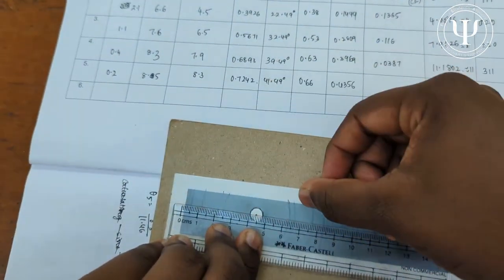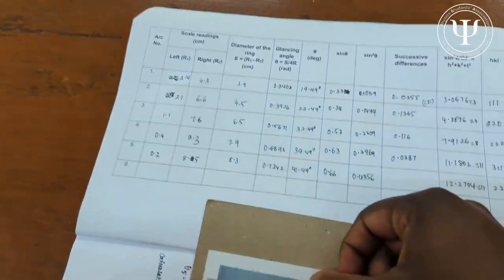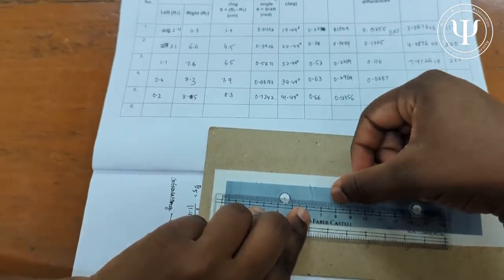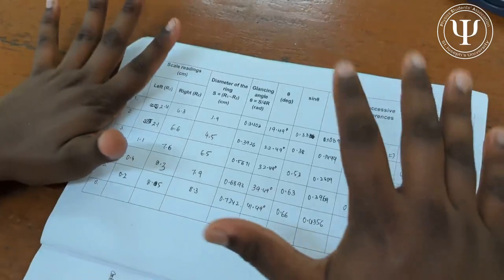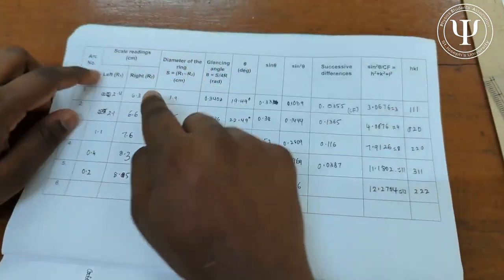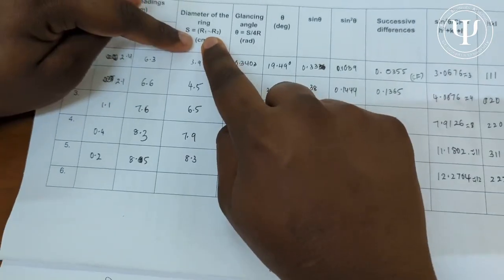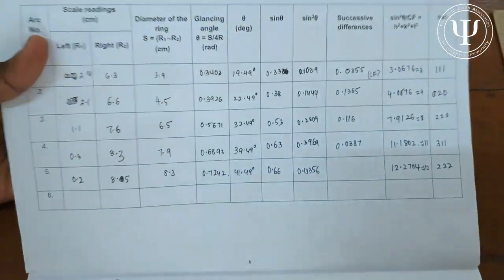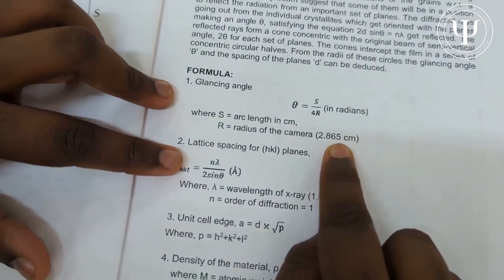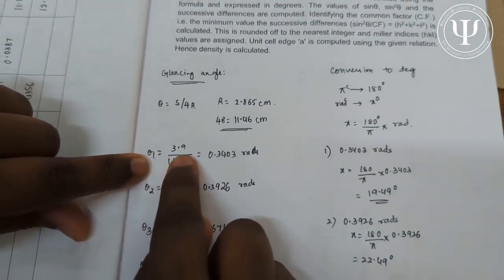After the left-side readings, take the exact distances from the reference point on the right side without changing the scale. The values are: 6.3 for the first arc, 6.6 for the second, 7.6 for the third, 8.3 for the fourth, and 8.5 for the fifth. The diameter is R2 minus R1 (right minus left), in centimeters. The glancing angle is θ = s / 4r, where s is the diameter and r is the camera radius of 2.865 cm, so 4r = 11.46 cm.